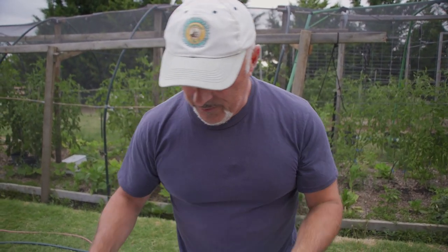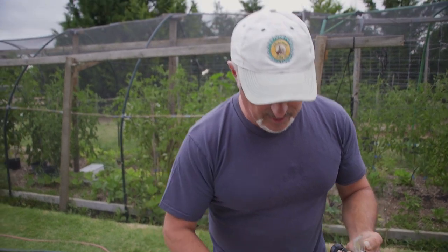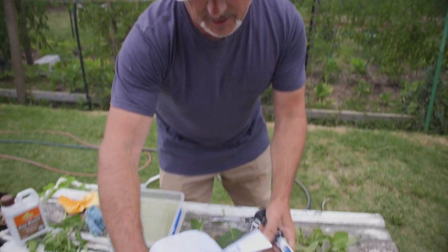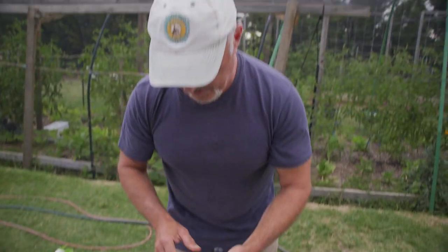And is that a bad thing? Well, let's have a look at the lowest numbers here - the lowest numbers are sitting around four. Everything should sit around average. So we've got broccoli here at four to six, carrots are six. The higher the number doesn't necessarily have to be a high, high number. But let's compare the light green to the dark green eggplant and see if there is a difference.